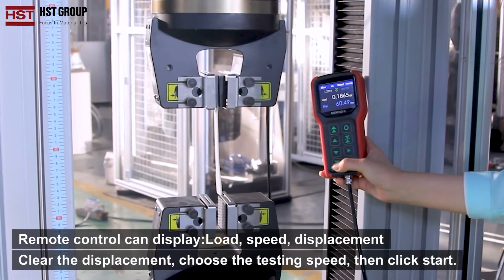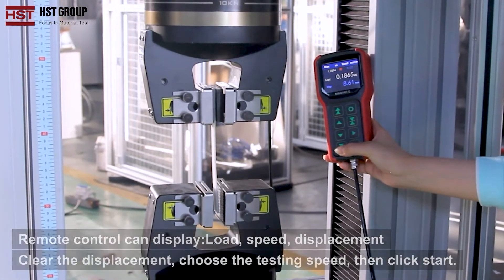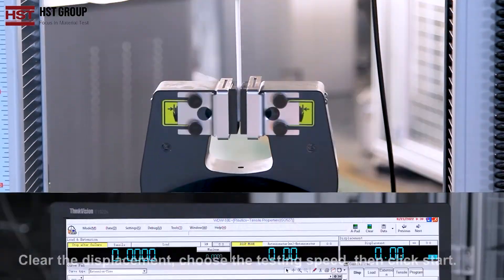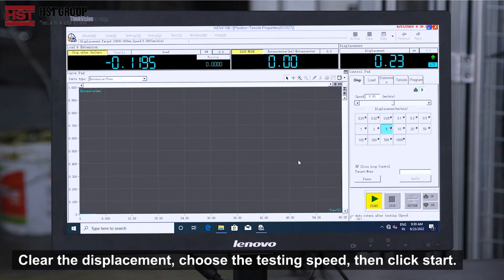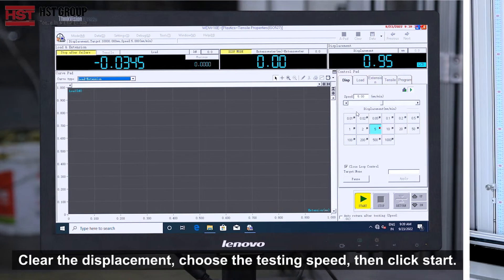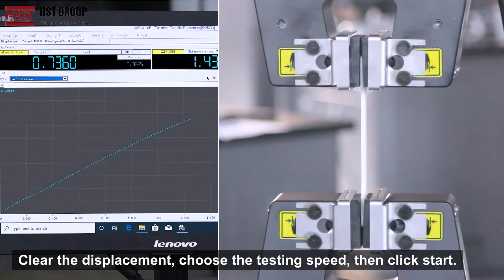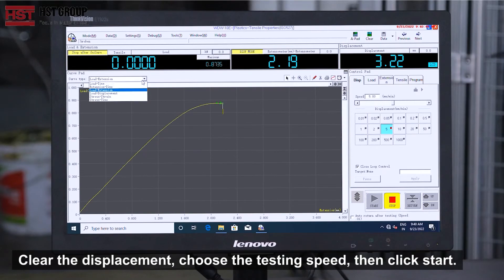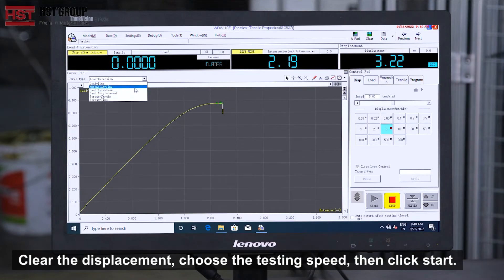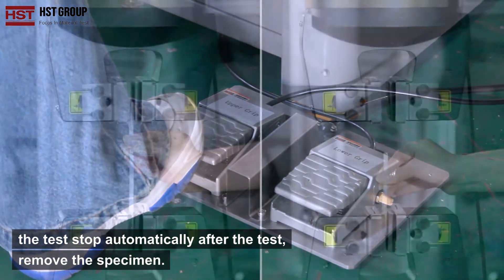Clear the displacement, choose the testing speed, then click start. The test stops automatically after completion.